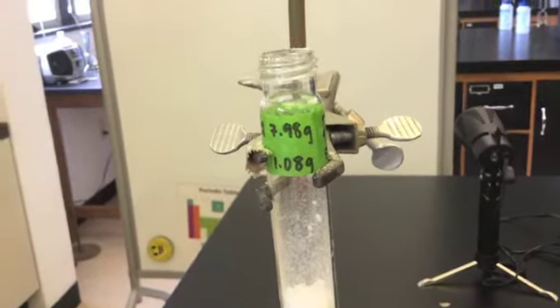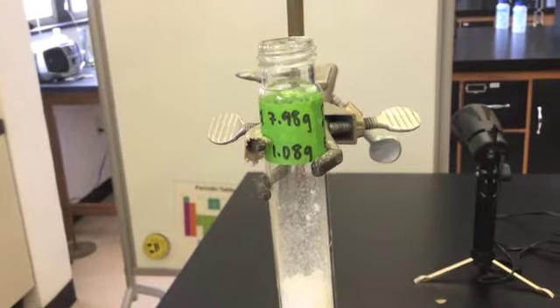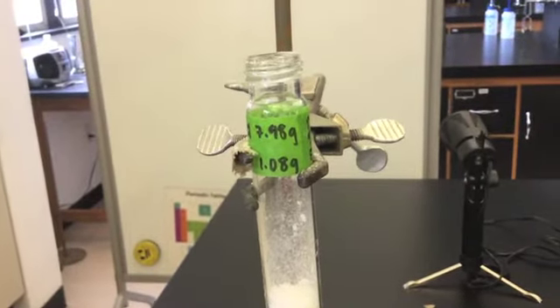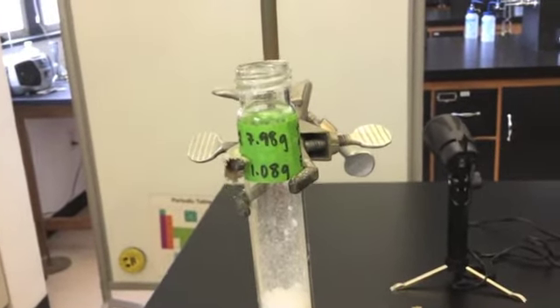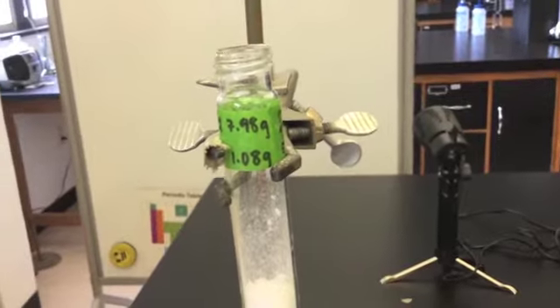This mass for the lauric acid does not need to be the same mass that was on the original test tube. Pure substances melt at the same temperature regardless of the mass. It is only the lauric acid in this test tube whose mass matters.